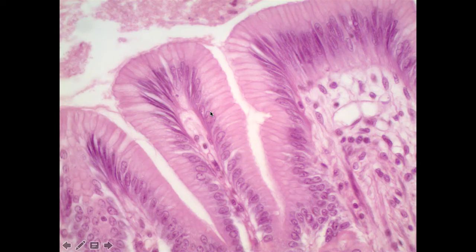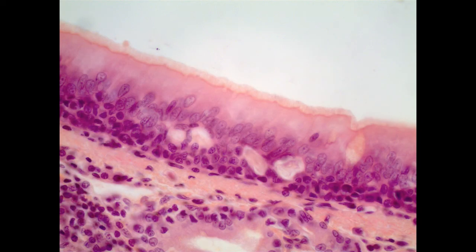Now, that's important because when we look at the fourth example that we're going to be looking at, this is from the trachea. And the layer that we see here is referred to as pseudostratified columnar ET. And the name is interesting because when you look at this, at first glance, you notice that the nuclei are not all lined up on the same level. There are some nuclei up here, and then there's a lot of them in this level. There's some down below. And so if you just use the nuclei, which are often really prominent because of how they stain, this appears as though there are multiple layers of cells.